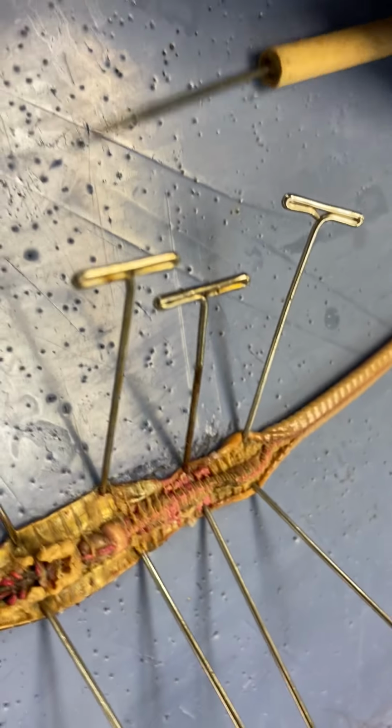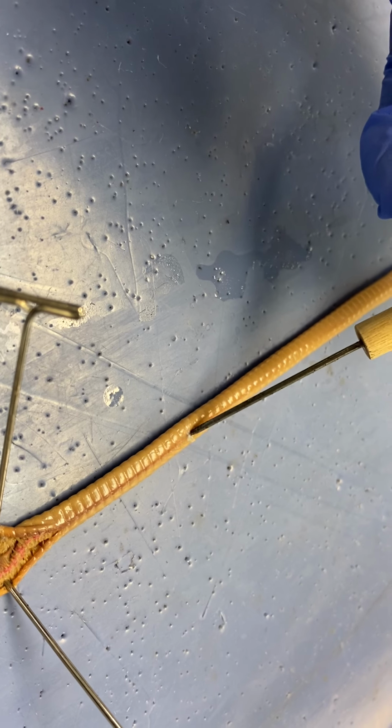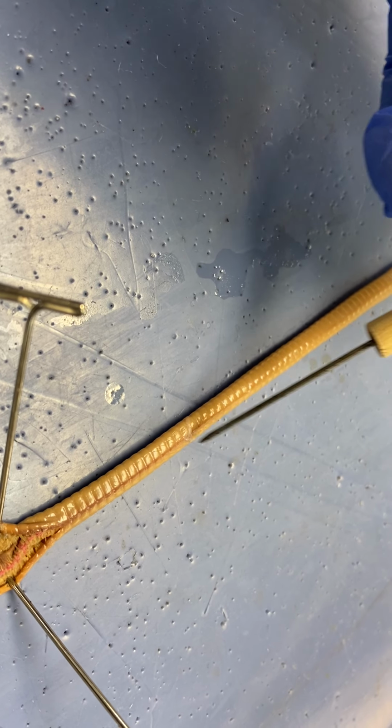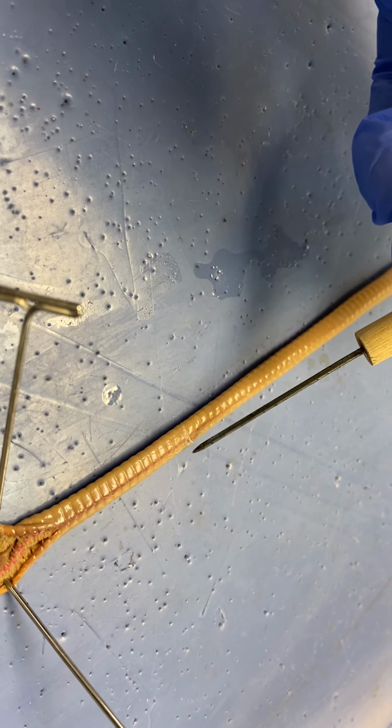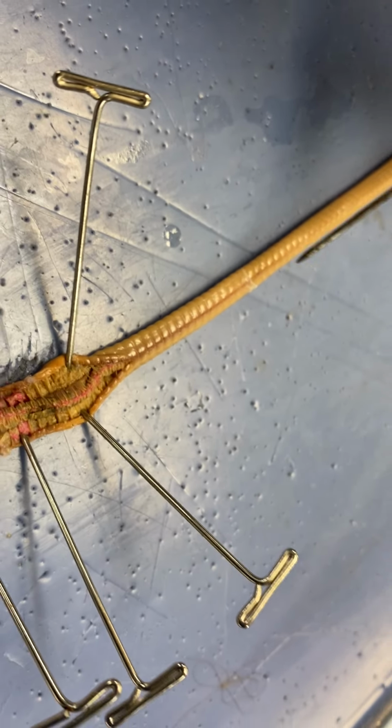The other thing I want to go over is, you can see it right here, a little waxy covering, the little film. That is the cuticle. So this little film right there, that is the cuticle.